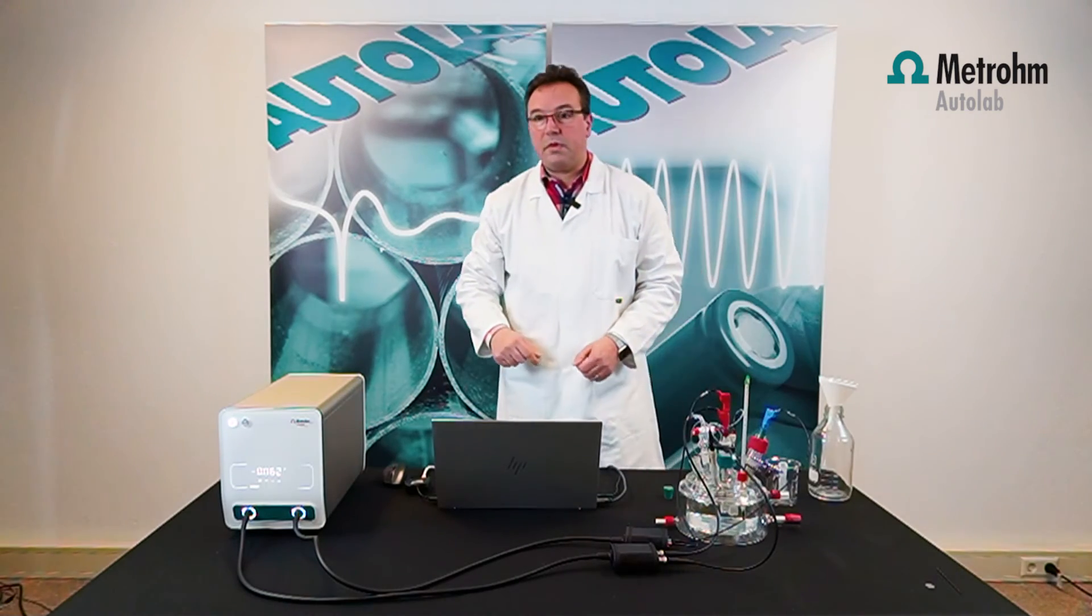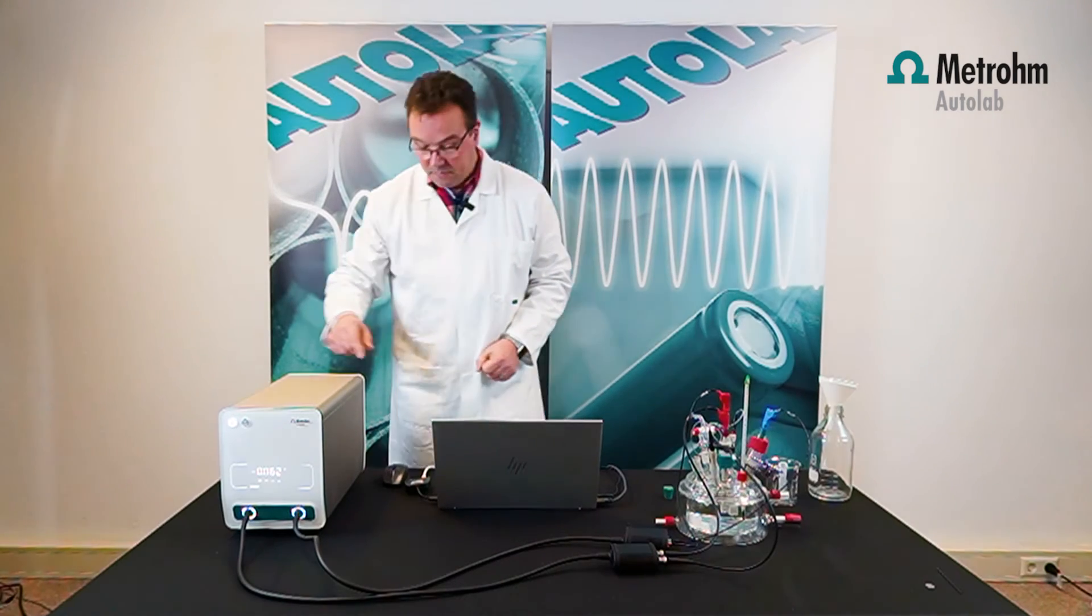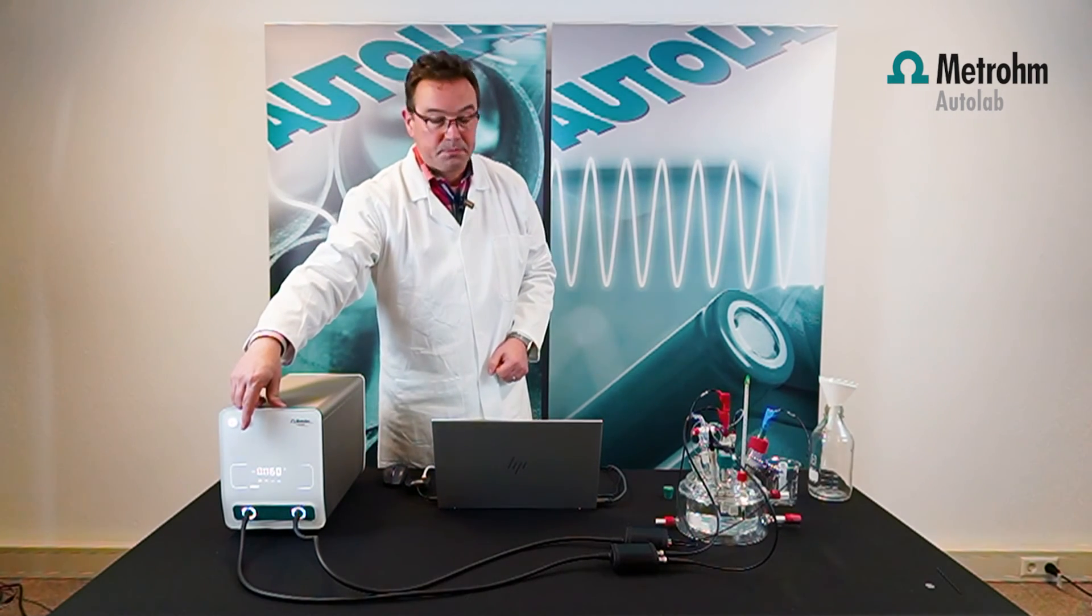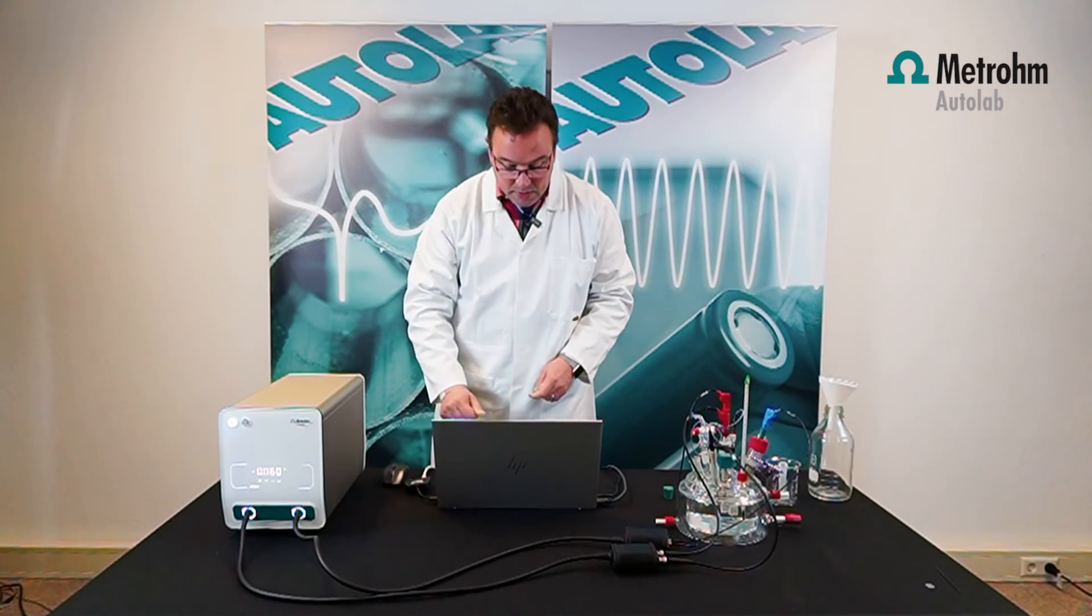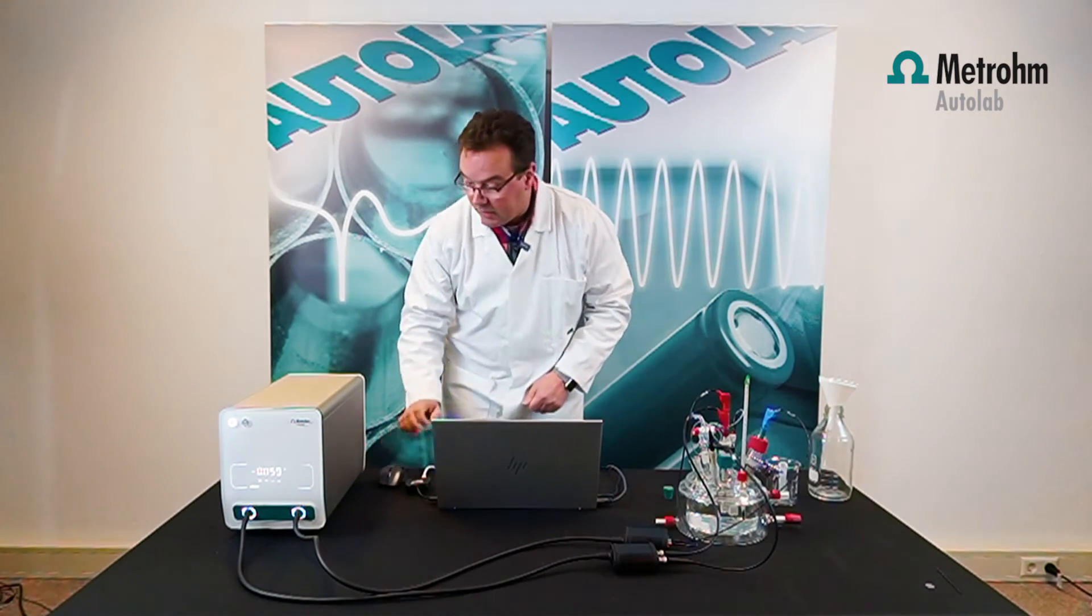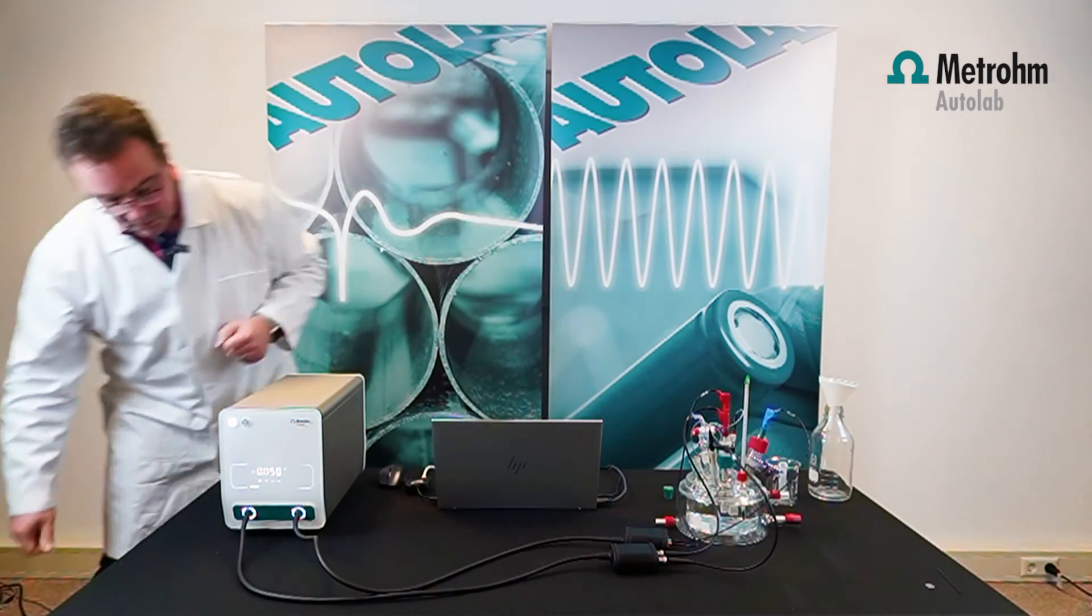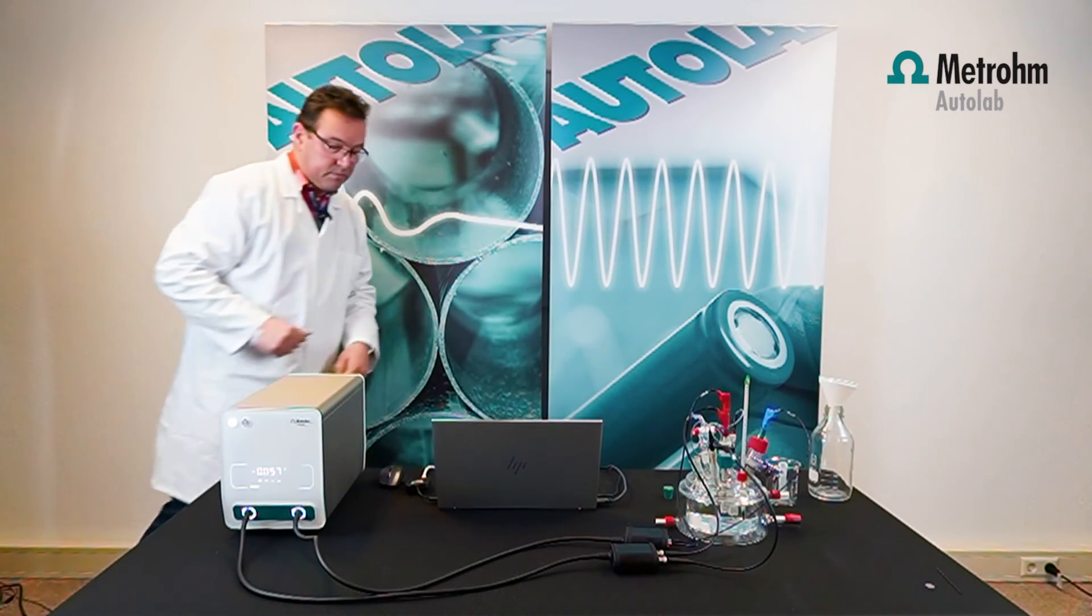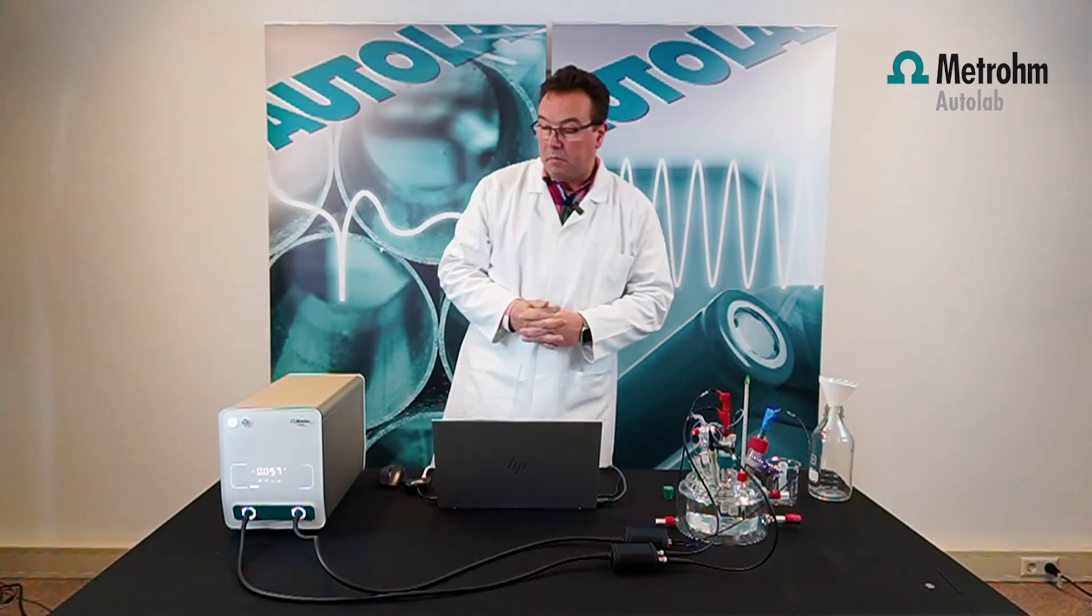Then we check on the Vionic OCP, open circuit potential. It is 57 millivolts.